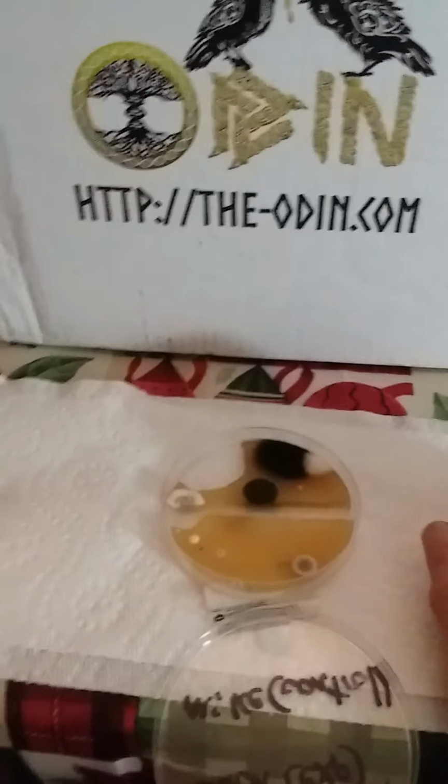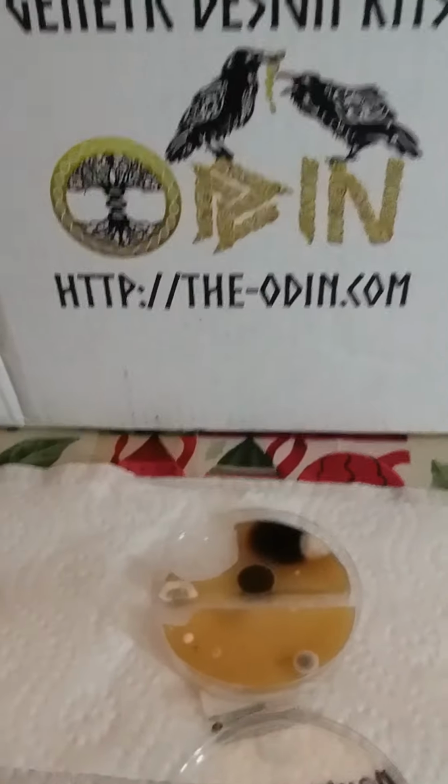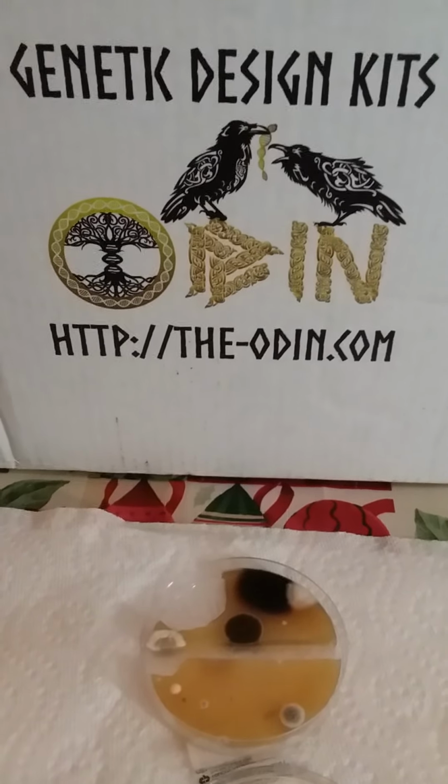This is actually sitting above. I don't know if you can see. It's a different kind of mold, and it sits above the media, whereas this black spot over here sits apparently inside the media. So, conclusion, this experiment was failure because of improper setup, and I'll have to do it again.